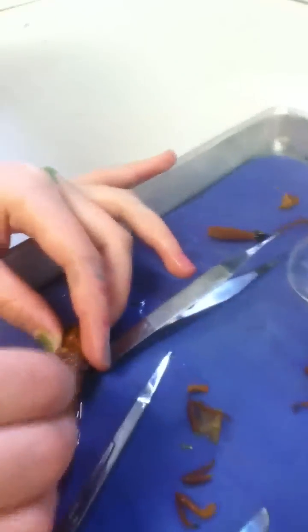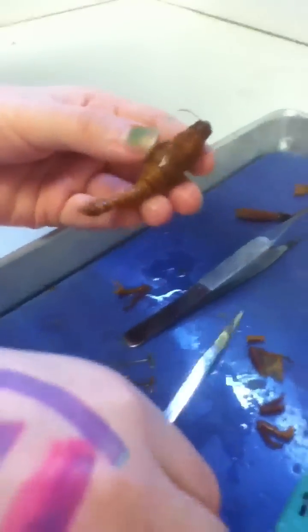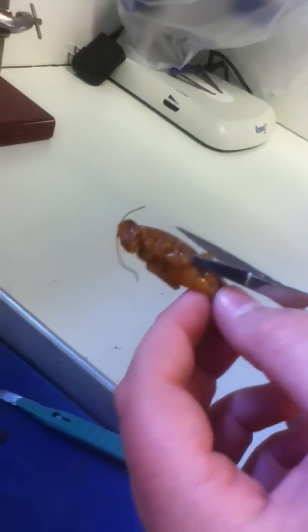Tim, can you help us? What? Should we... what am I helping with? Cutting. Oh, I can cut it. Okay, Tim. Alright. See ya little sucka.